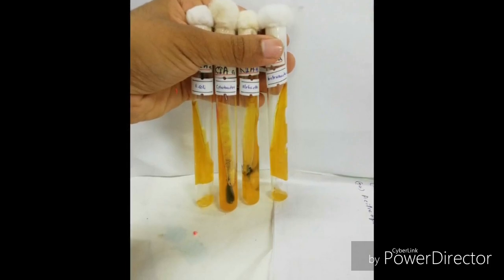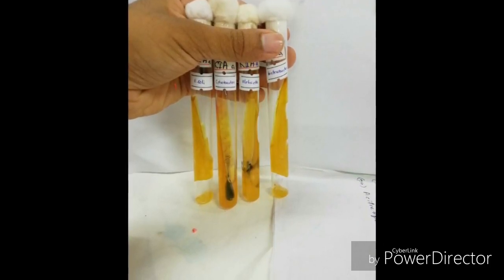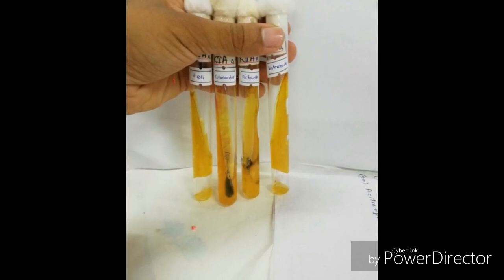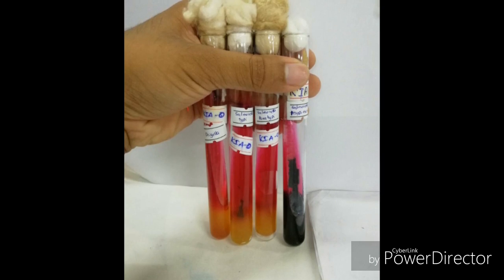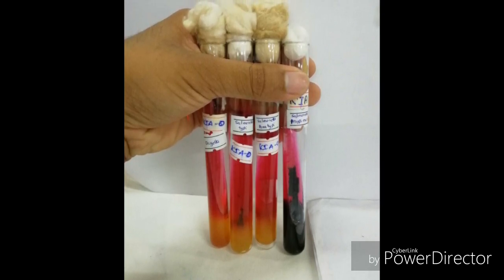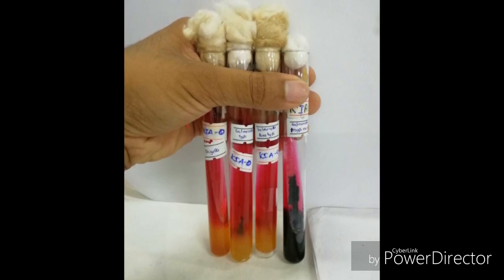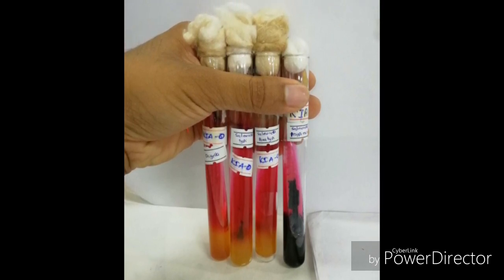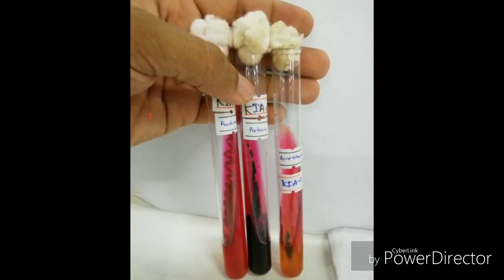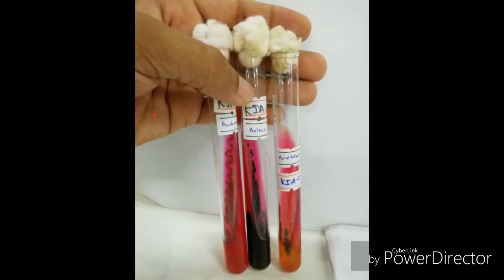The uninoculated media is red in color. If the organism is a lactose fermenter, the whole media converts to yellow. If it is a glucose fermenter only, the butt position turns yellow and the slant converts to pink. If the organism produces gas, we can observe cracks. If the organism produces H2S, we observe black color changes.